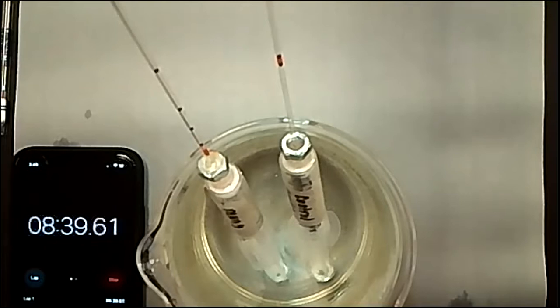Oh, it looks like we had a sudden jump. Maybe it's because the inside of the tube wasn't lined very well, so then it doesn't move smoothly down. So that means that the pressure was building up and up and up and up, and oxygen was being used up and up and up until it was strong enough to pull it through the tube when it wasn't smooth for it to just move through by itself originally.